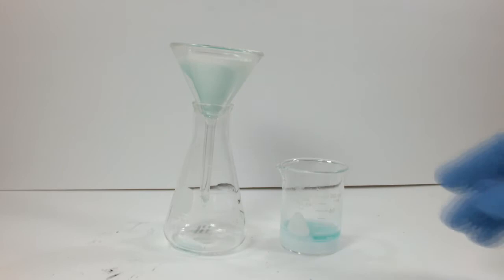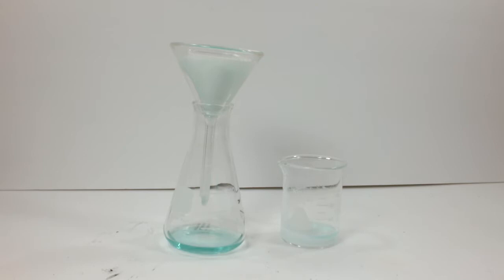Here we have the nickel chloride solution and barium sulfate precipitate. I'm going to use the finest filter paper I have because barium sulfate is notoriously difficult to filter. This is going to take a while, but I'm sure it will be worth the wait.